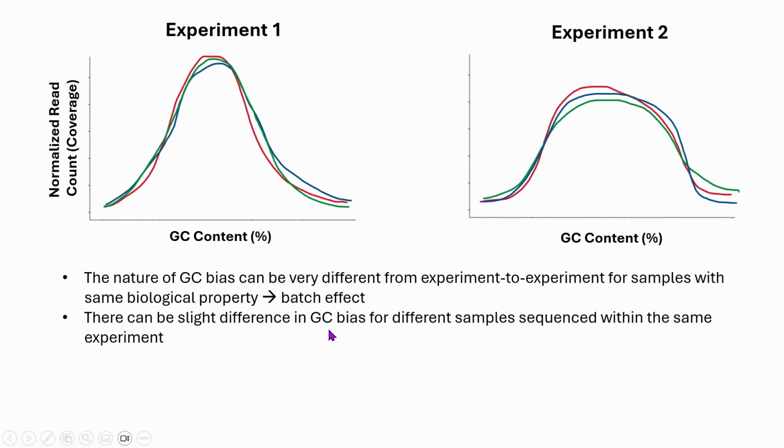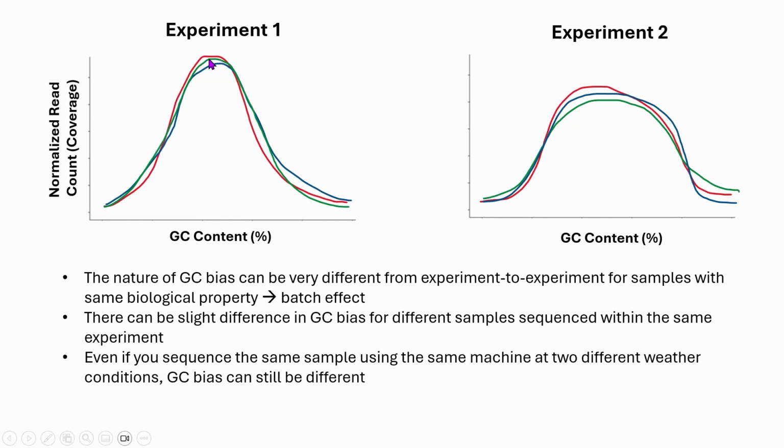And there can be slight differences in GC bias for different samples sequenced within the same experiment, which we are seeing right here. Here is the most interesting part. Suppose we take this red sample right here and we sequence it in the morning, on day 1, and on day 7, we sequence that same sample again in the afternoon in the same lab. You would expect the two curves to be exactly the same because it is the same sample sequenced in the same lab. But no, there will still be some difference because of the time difference and the difference in environment, such as temperature, humidity, etc. That is also an interesting fact to understand.